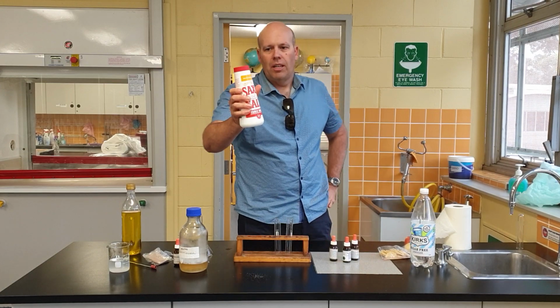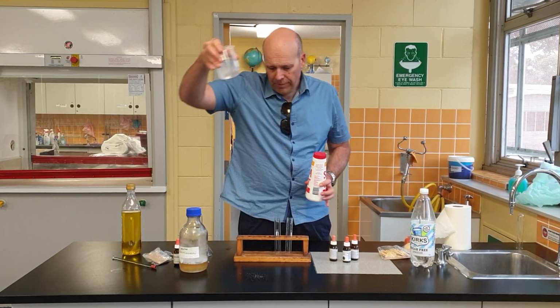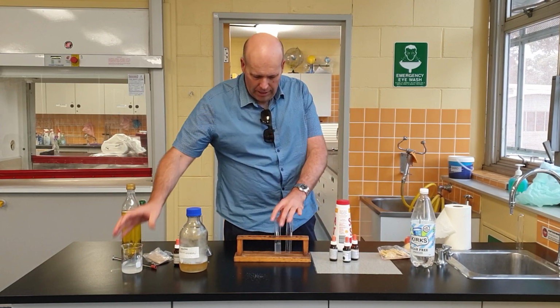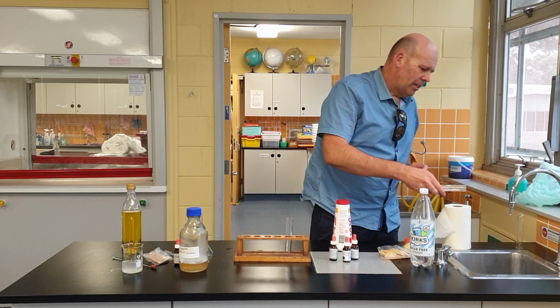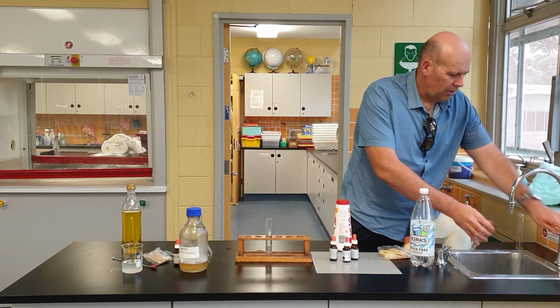What I'm going to do now is put some salt into some water, salty water, and I'll have some plain water as well as our control.